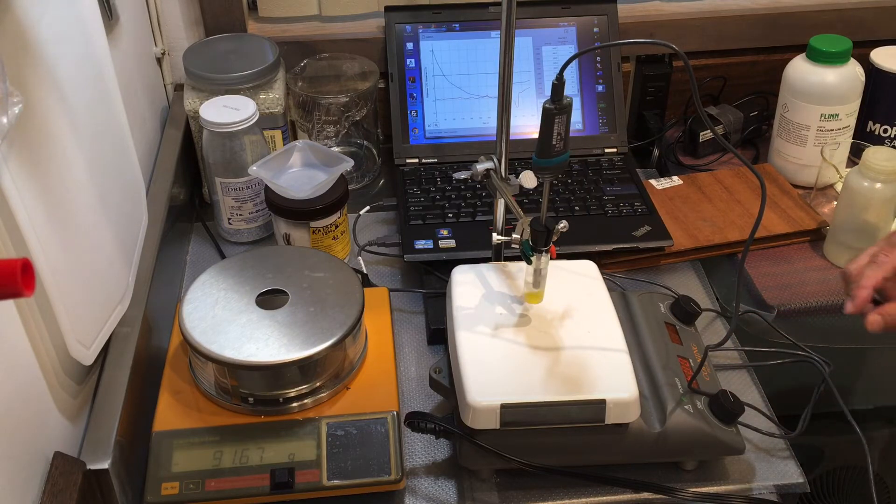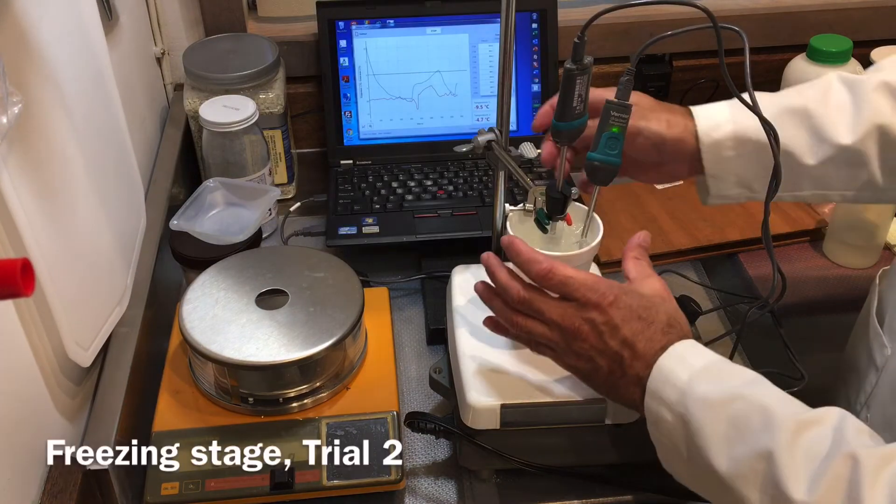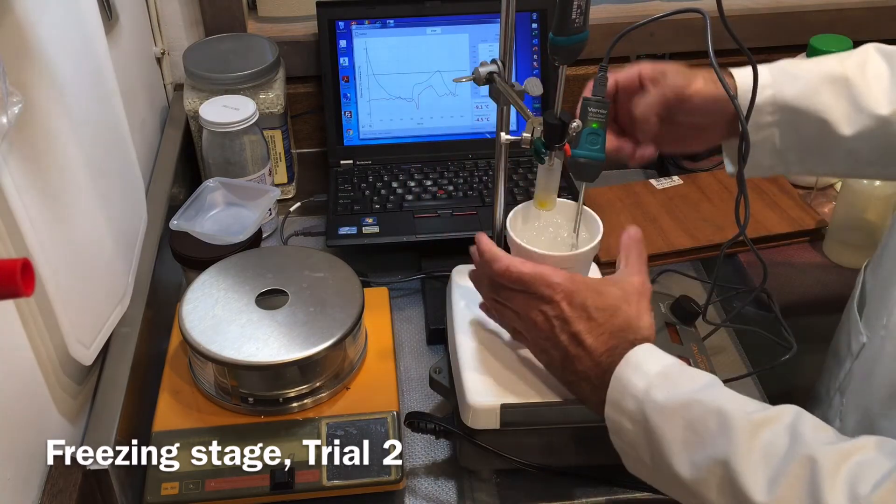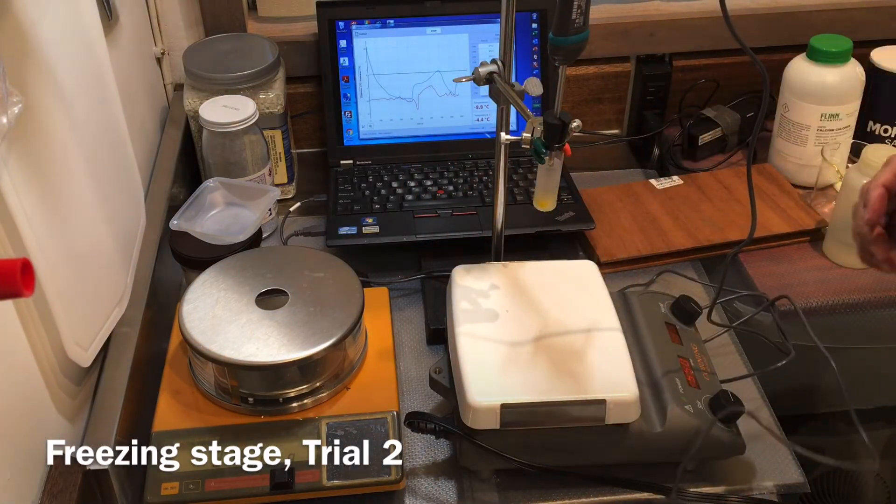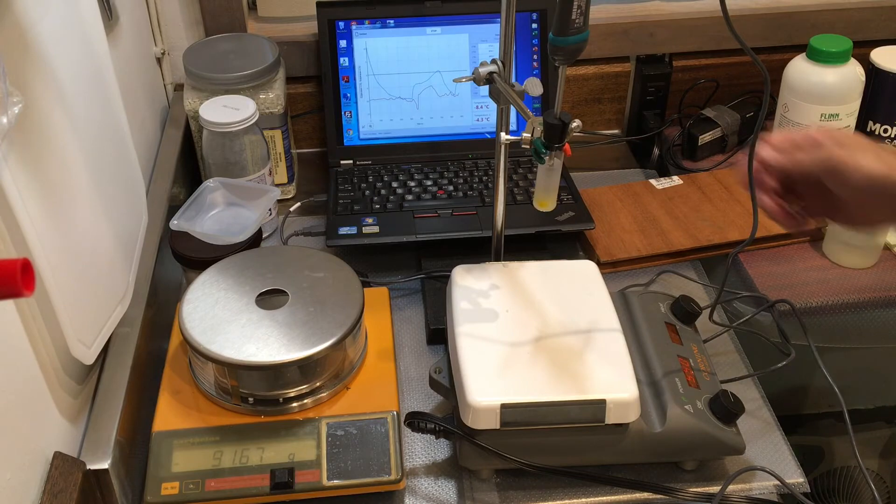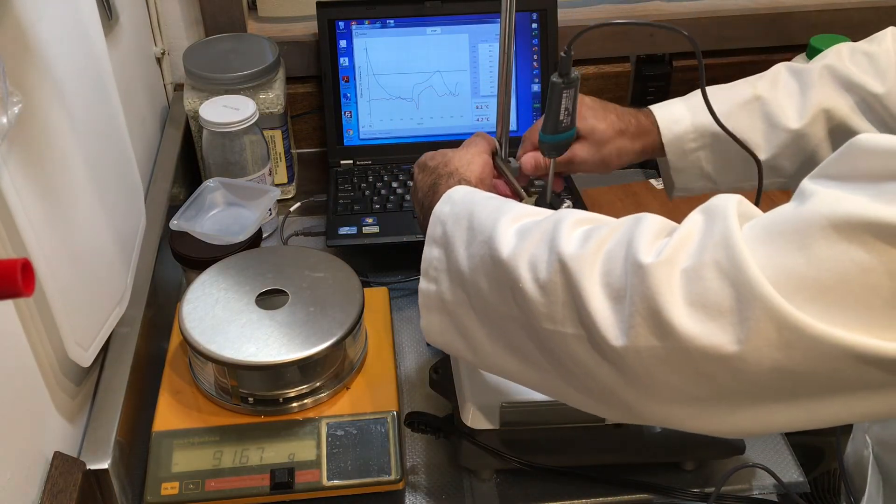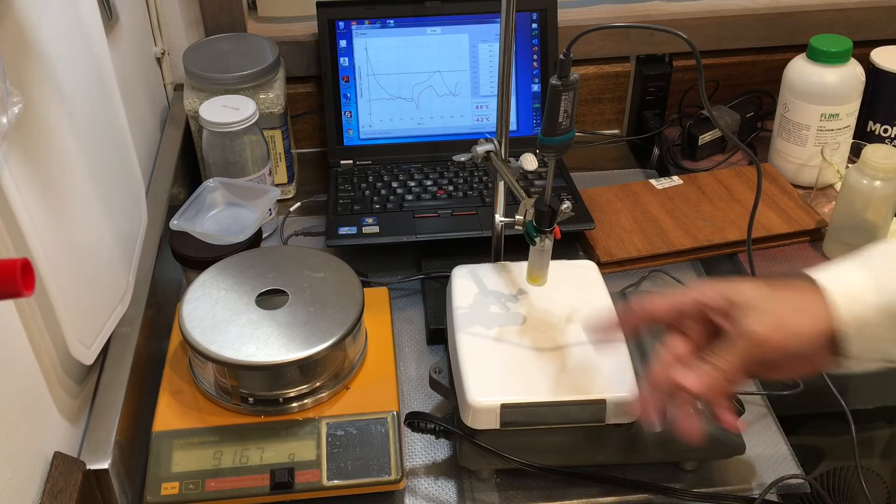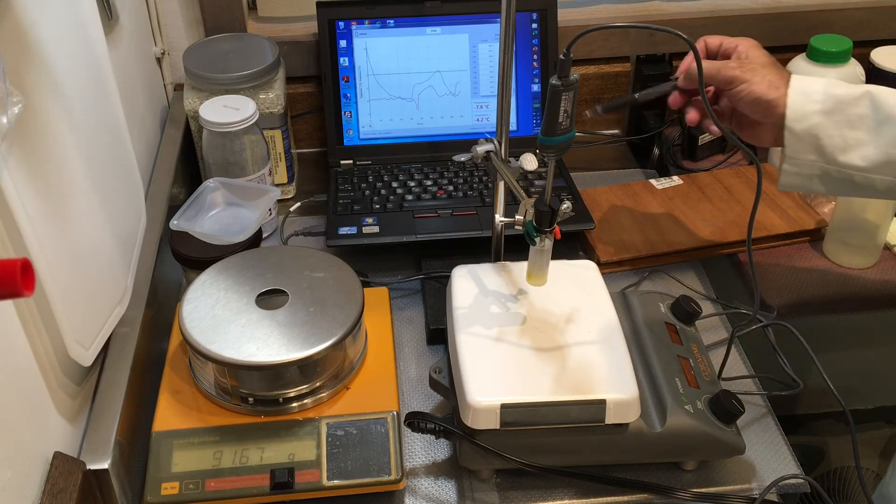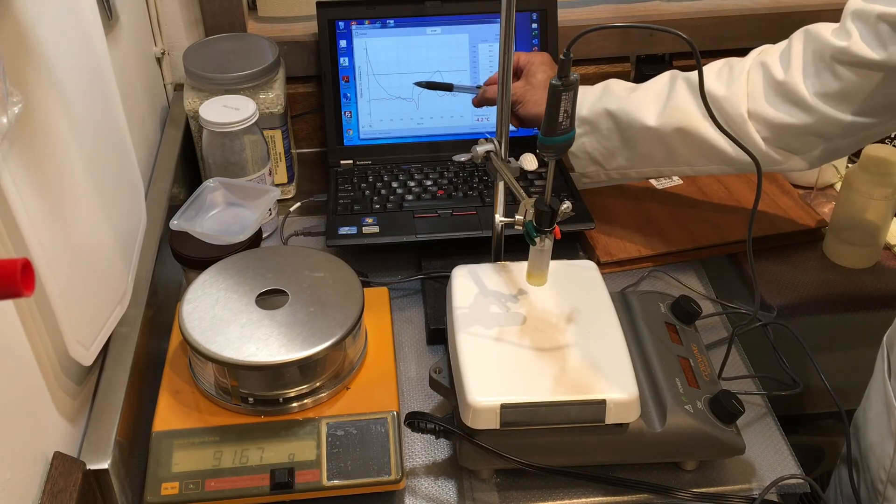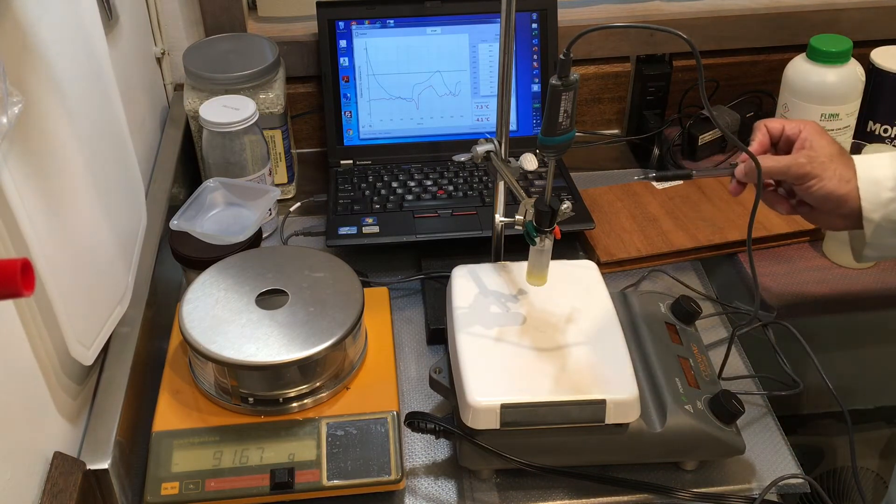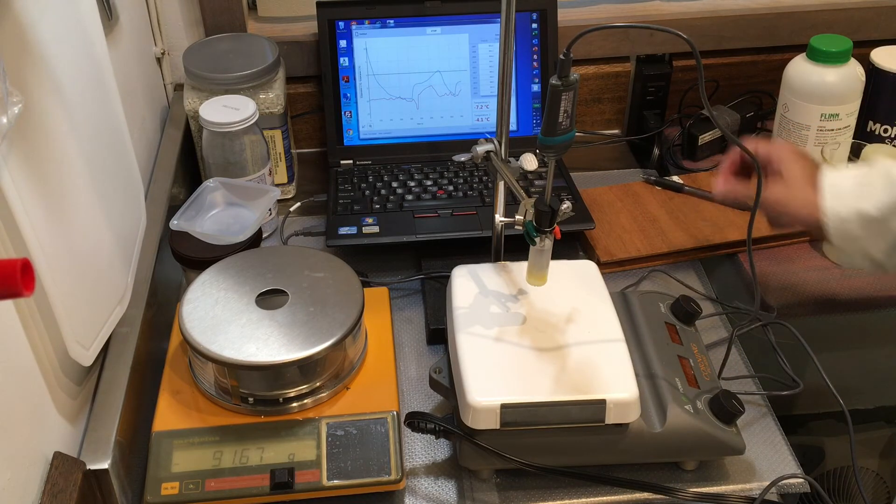Now we are definitely in the melting zone. Freezing has taken place, so I'm going to remove this. It's cold enough that it will continue to be frozen. You can see that the temperature is pretty low. The stirrer has stopped. Negative 4.2 like last time, so this is what happened last time. It came up, and it started to become constant temperature, and still hasn't melted yet.